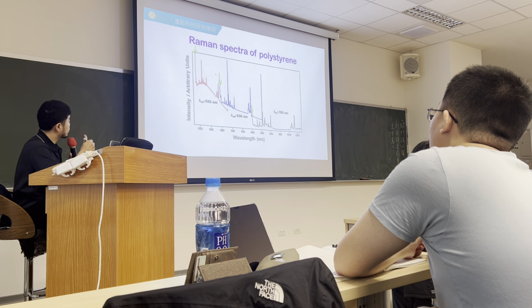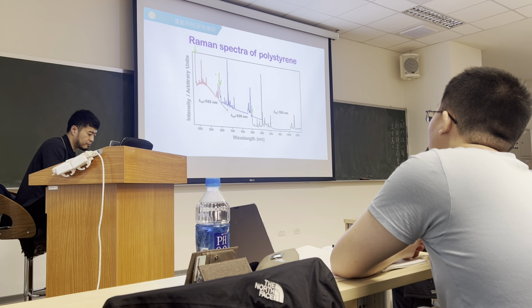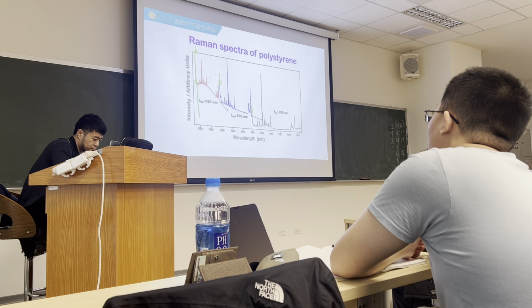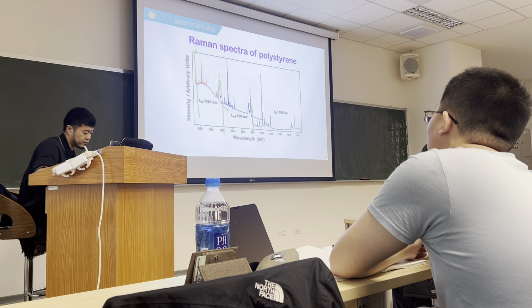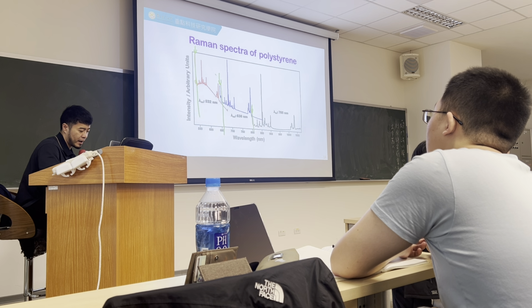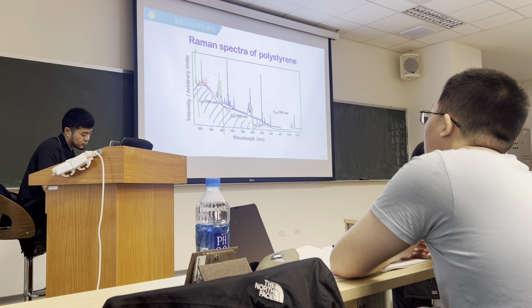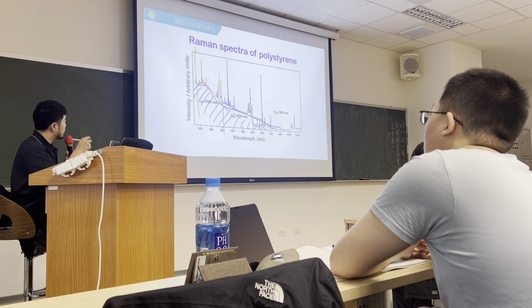The arrow I plot is somewhere close to your excitation laser wavelength. Okay, so this is where the Rayleigh light scattering occurs. All your spectra are plotted based on this excitation wavelength. To look at this further, you can realize there's a background over here, right? Those backgrounds make some of the signal not so obvious.